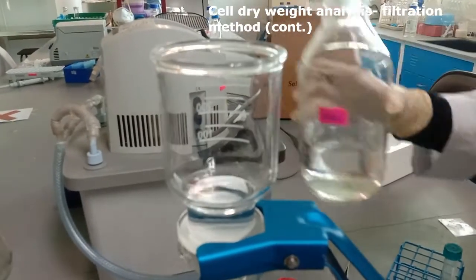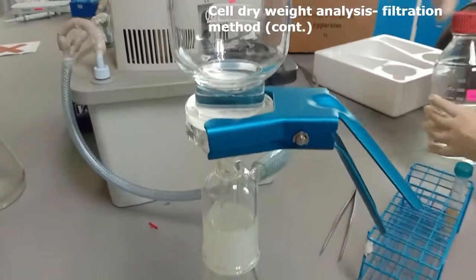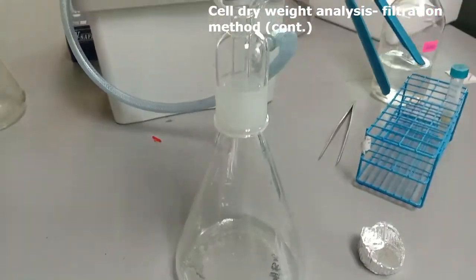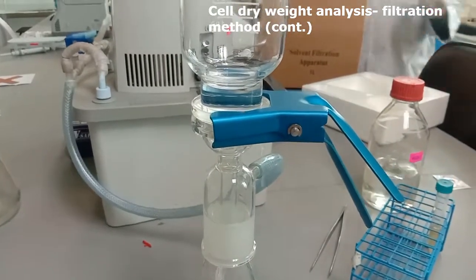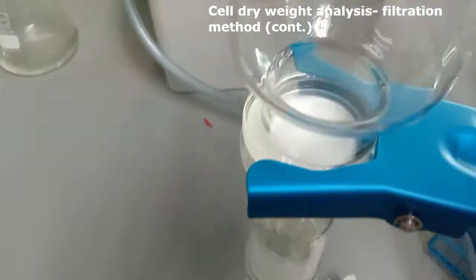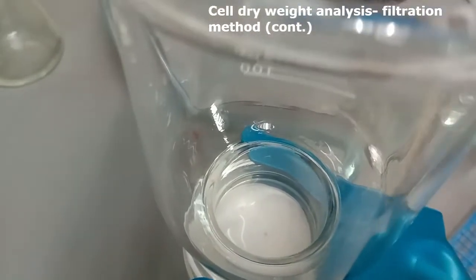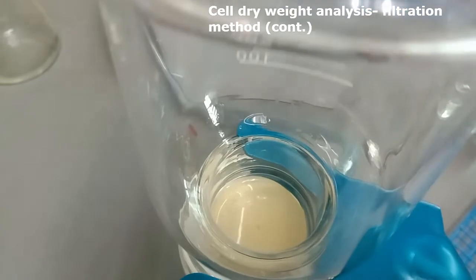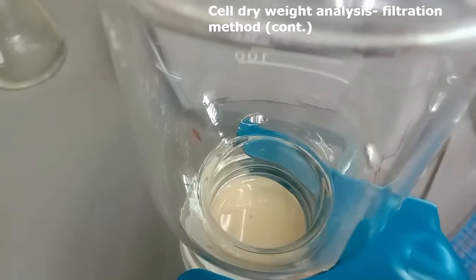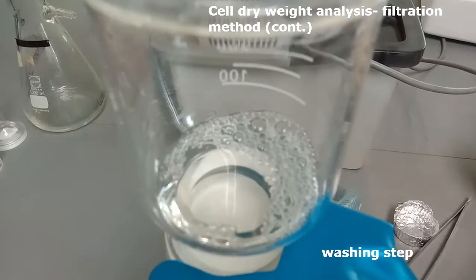Then place the membrane filter that has been weighed on the filter system and carefully assemble the system and turn on the vacuum pump. Next, wash the filter membrane with distilled water. Then pour the 50 milliliter sample onto the filter membrane. Wash the filter membrane 3 times with distilled water.